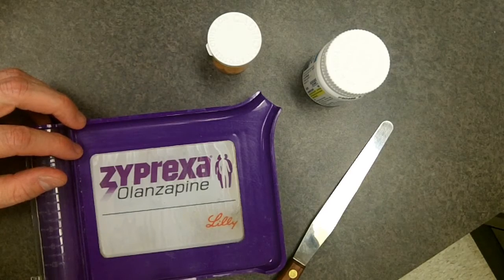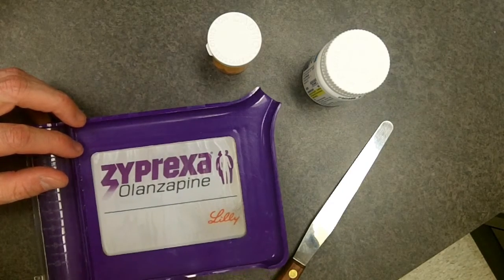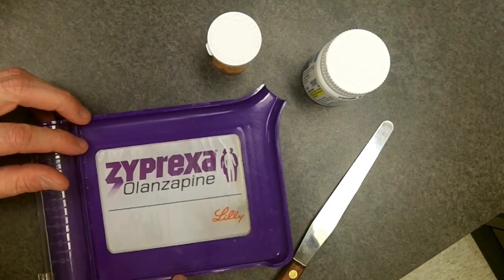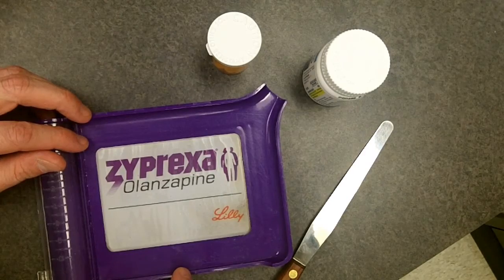Make sure you never touch the tablets with your bare hands, and always count by fives. Many people will try to count by threes or fours, but I really recommend counting by fives because that is the pharmacy standard.